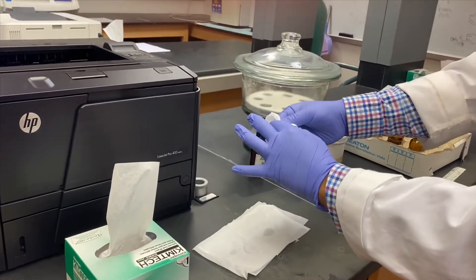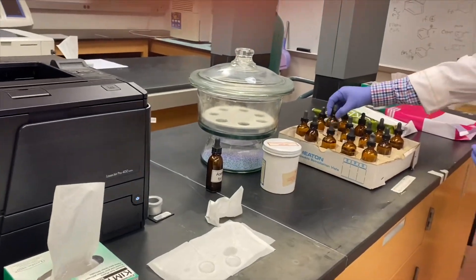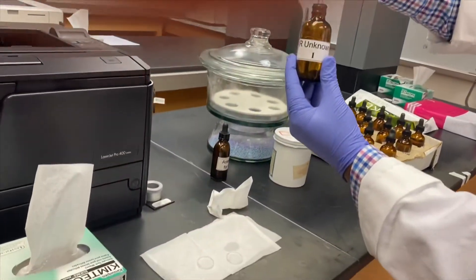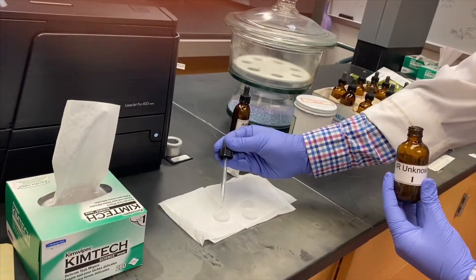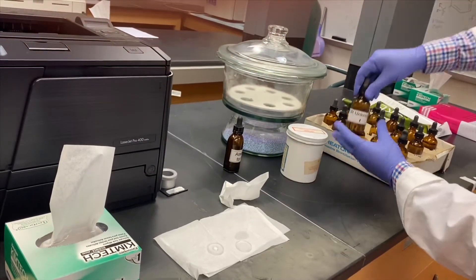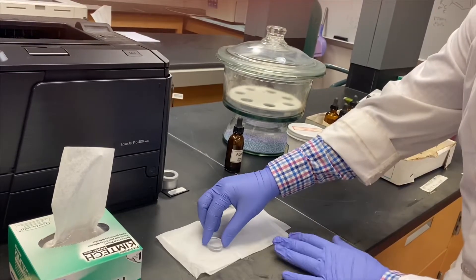Once the plates are clean, place a drop or two of your unknown sample on one of these plates. Pick up the other plate from the edges and place it gently on the first plate to sandwich the solution.